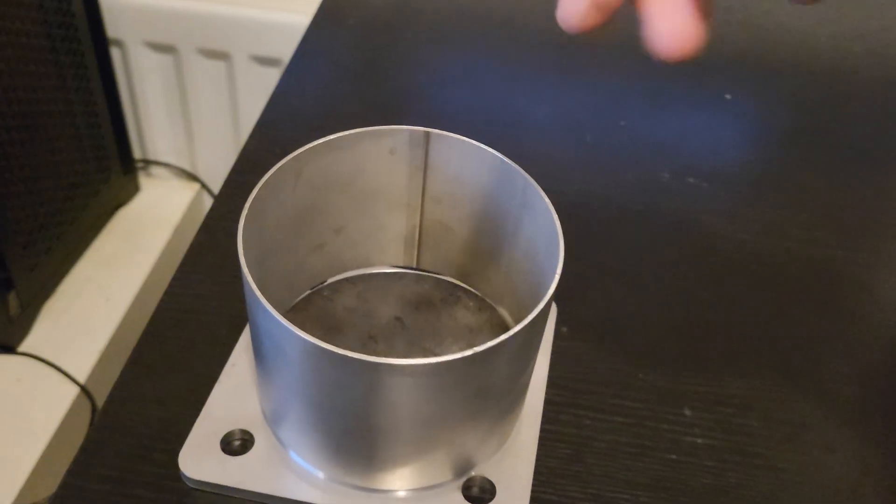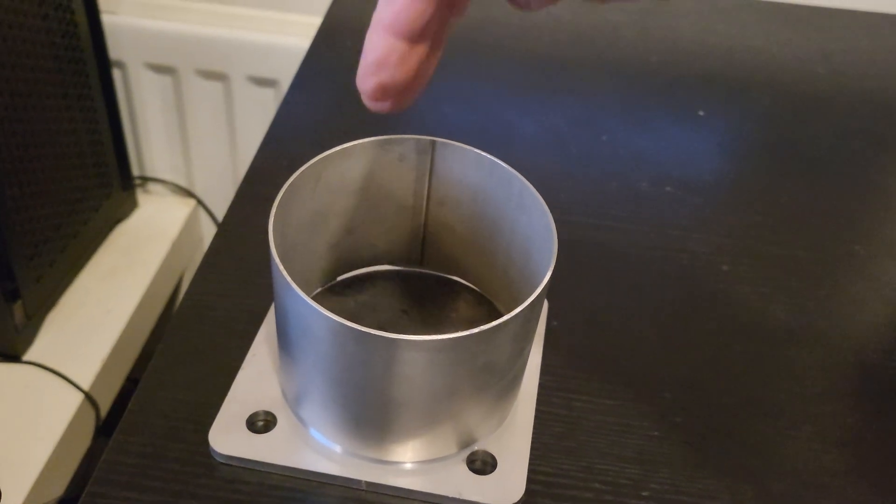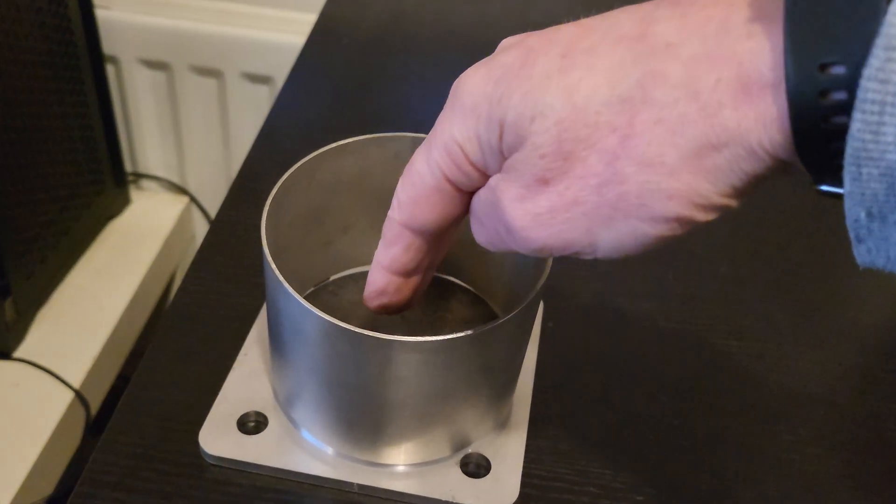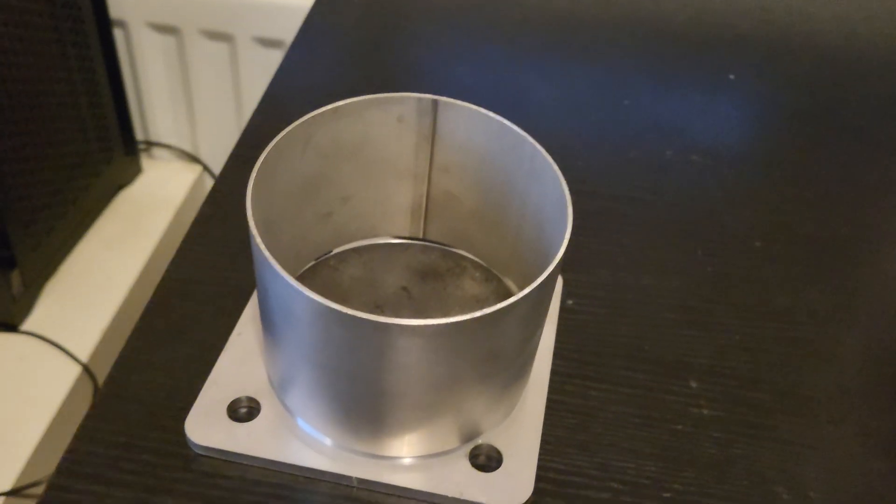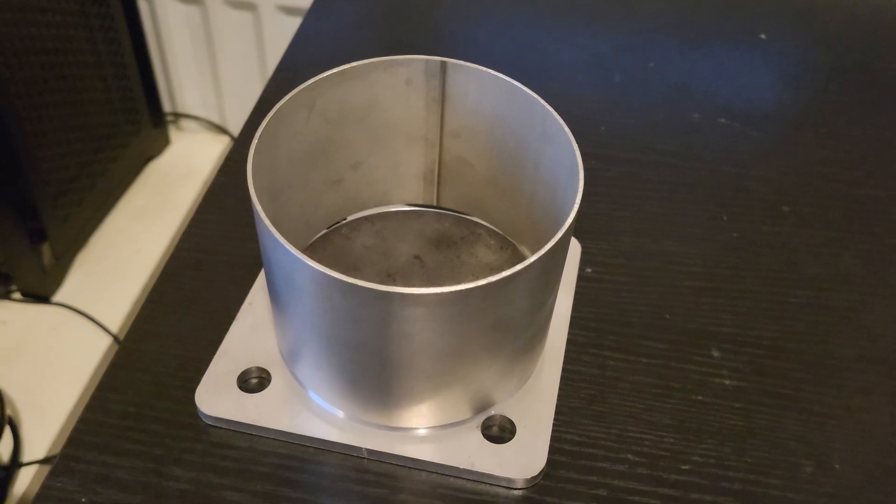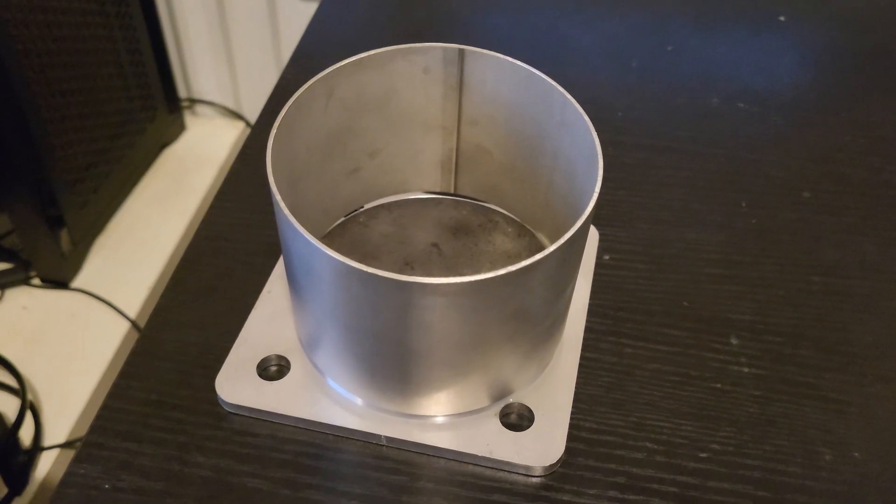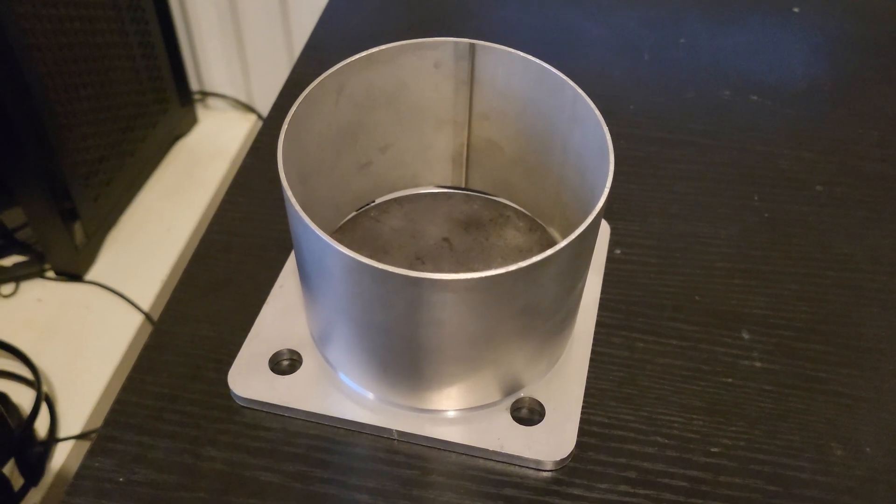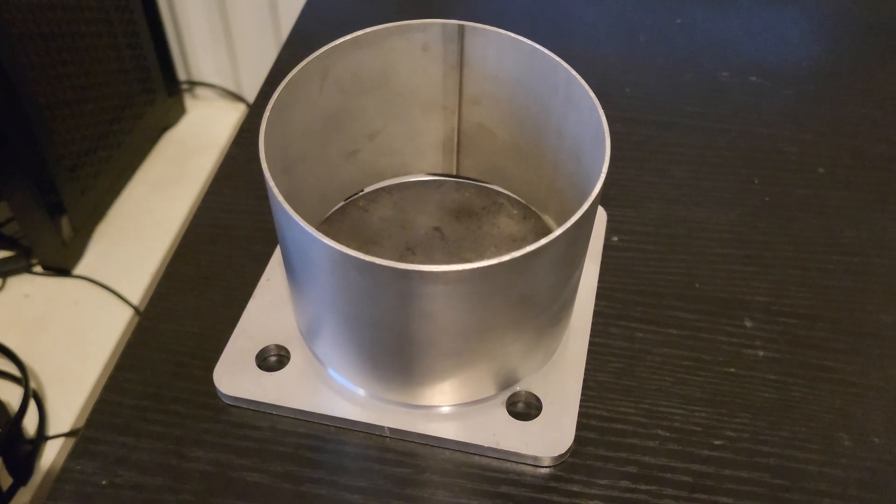And then the press, down there, should be 10 tons for about one minute.